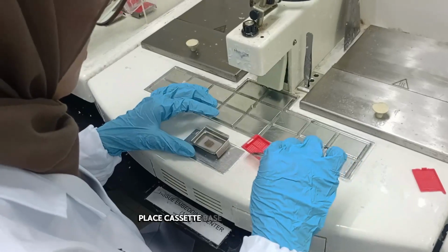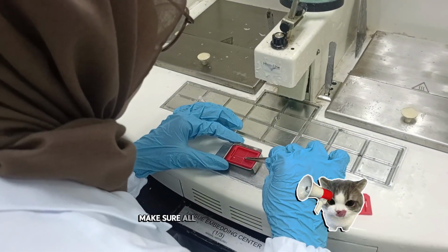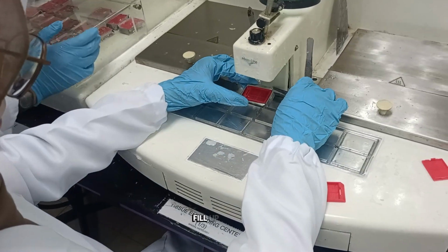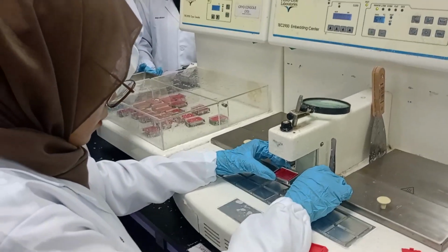Place the cassette base on top of the mold. Make sure all the cassettes are level. Fill up the wax until the cassette base is immersed in wax.